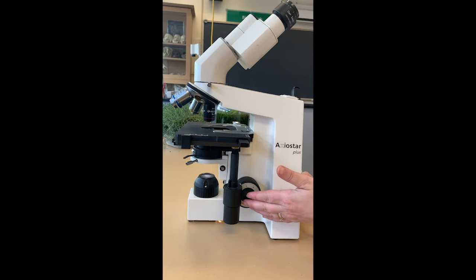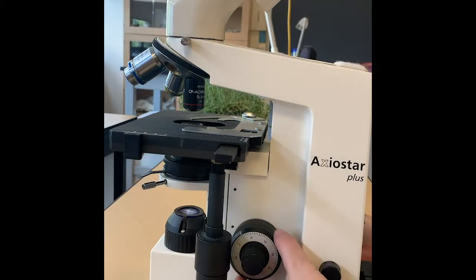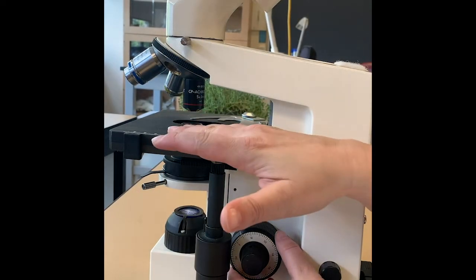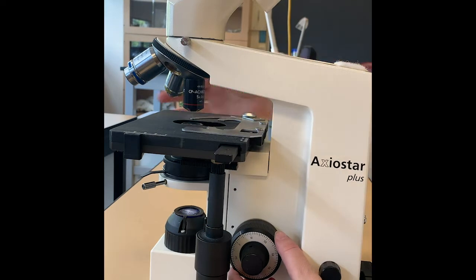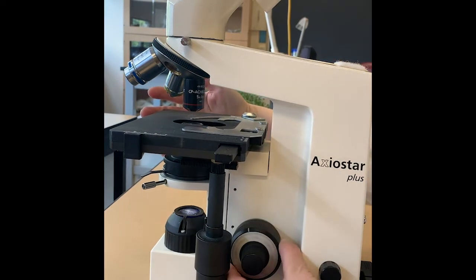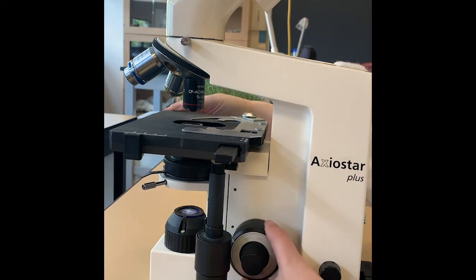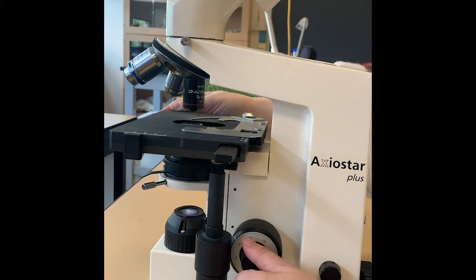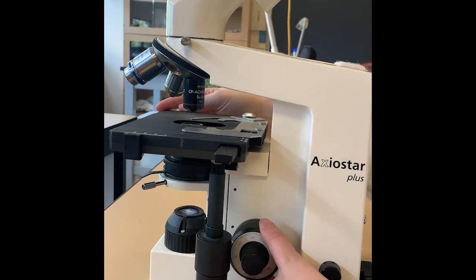Moving along here, we have the focus knobs. So we have coarse focus and fine focus. The focus knobs basically move the stage up and down. The coarse focus moves it fast. The fine focus is more delicate movements, and that will help you bring your slide into focus.